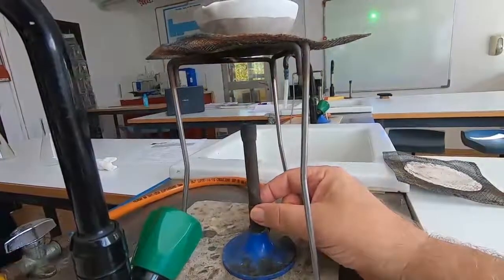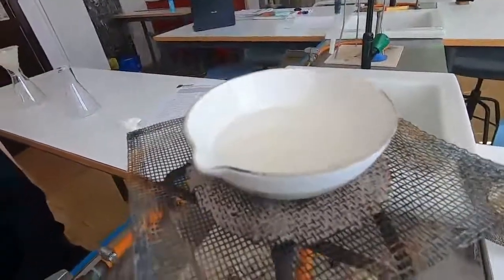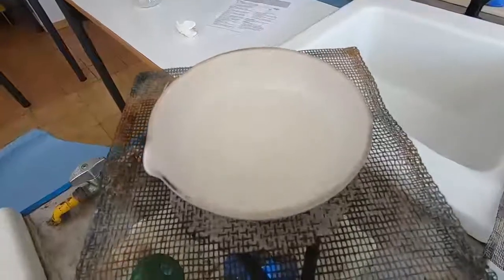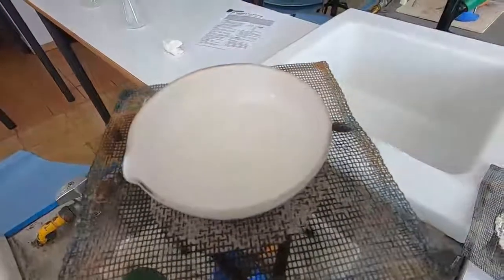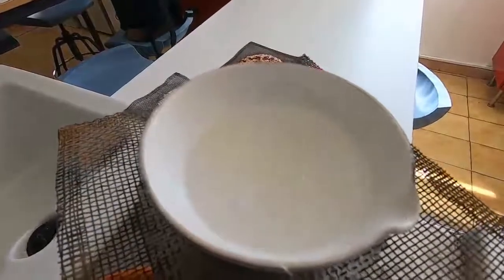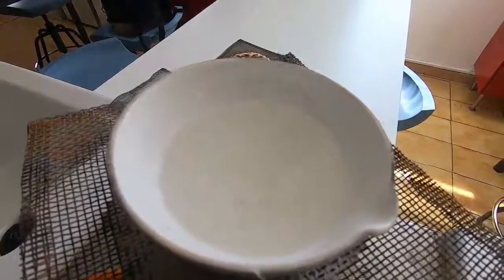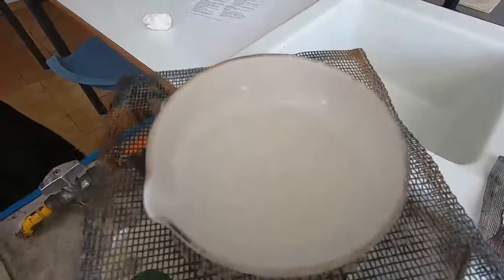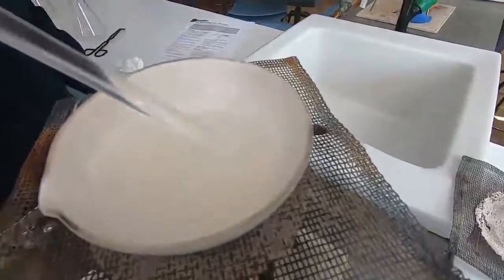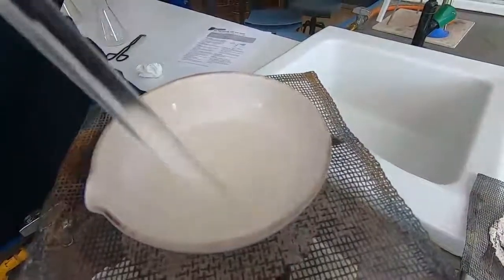Fairly gently, we've got to remove most of the water, so we'll heat that up for quite a while to allow the water to evaporate and leave the salt behind. As the water evaporates you may see crystals start to form around the edge — with the glass rod you can push those crystals back into the solution so that they dissolve. You probably need to remove about two thirds of the water at this stage so that the crystallization is quite rapid. We push the crystals back into the solution so they re-dissolve and we end up with a saturated solution.